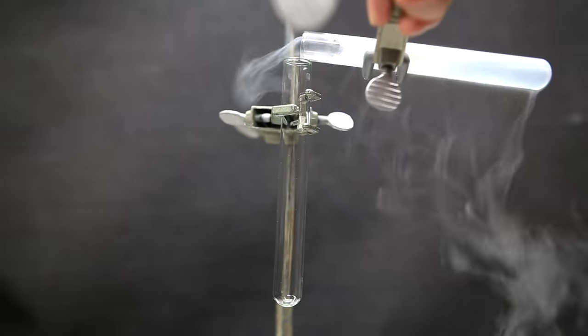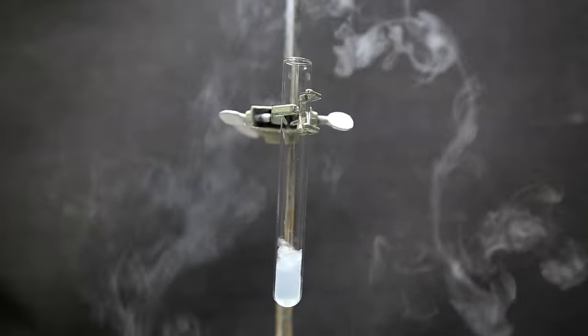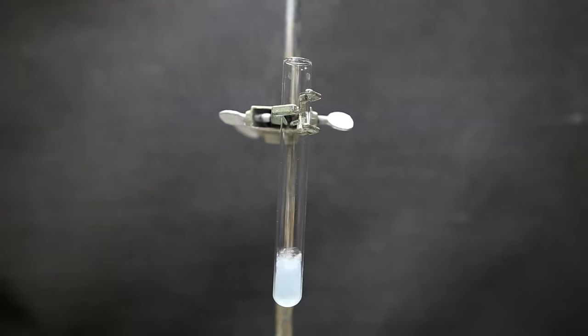From the large test tube I transfer some of the liquid oxygen into a smaller tube. As it cools down the test tube it boils a lot but eventually it settles down.